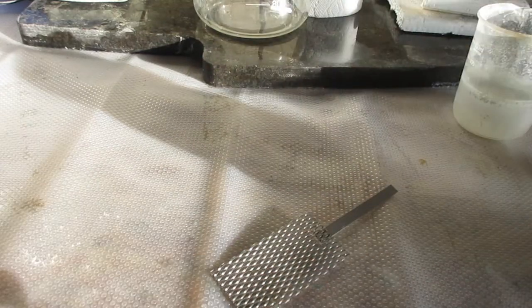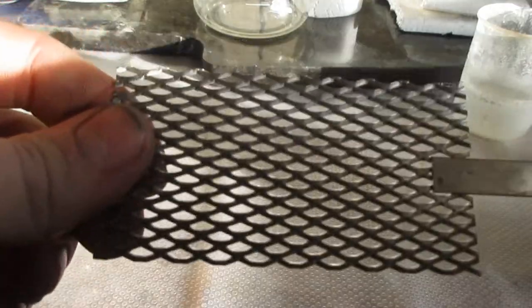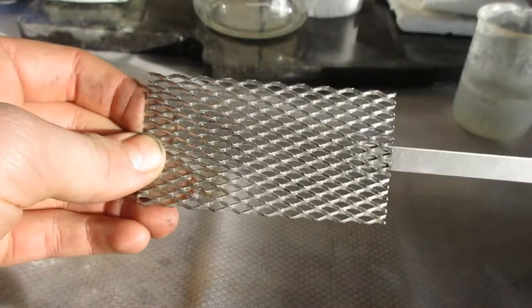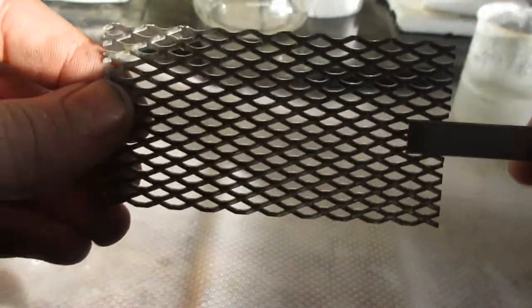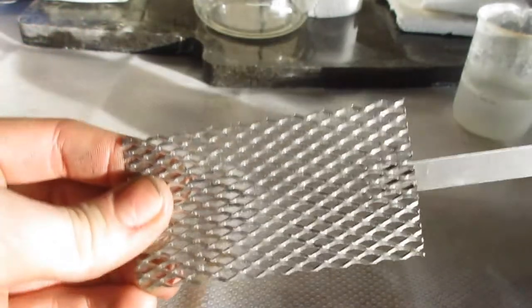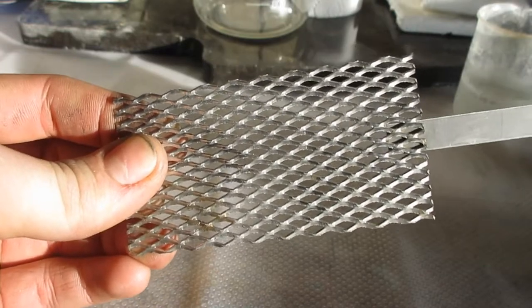Hey, Superfluous Science here. So recently I ordered this platinum anode off of Amazon, and the listing looked a little bit sketchy, so the whole time I was kind of crossing my fingers, hoping that it wasn't a fake, but lo and behold, got it in the mail, checked it, and it was a fake.